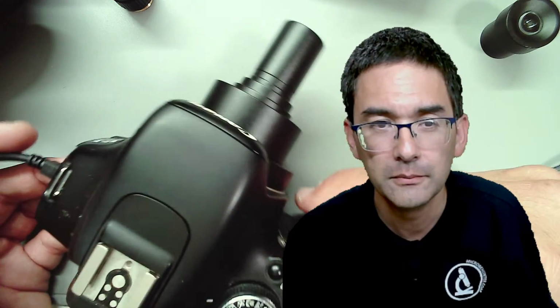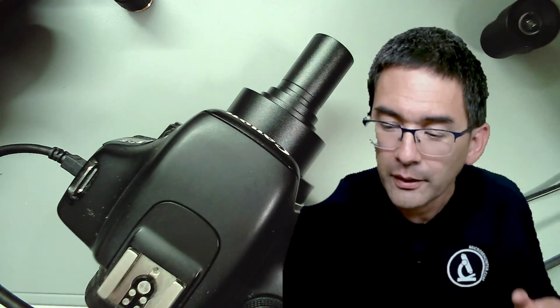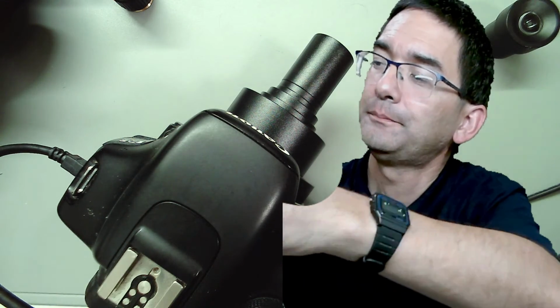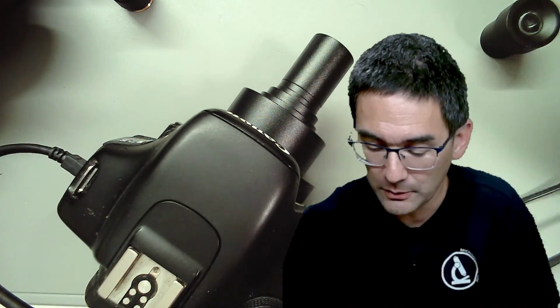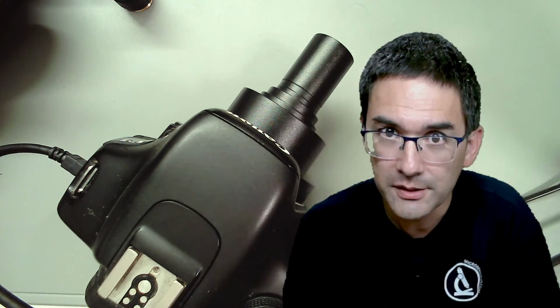I'm going to show you now a couple of issues here and how DSLRs can be connected. I'm going to step you through all of the possible options that I know of. Let me put the other one back again. With all of the advantages and disadvantages, and I'll also talk about the reason why there is chromatic aberration. By the way, you can remove it by doing some picture editing.